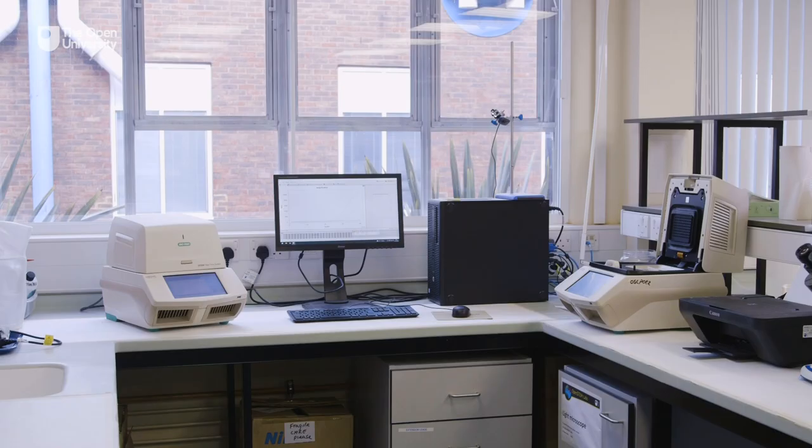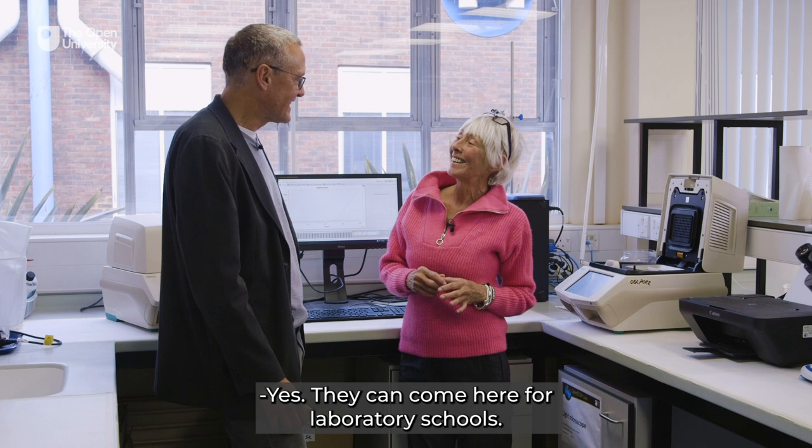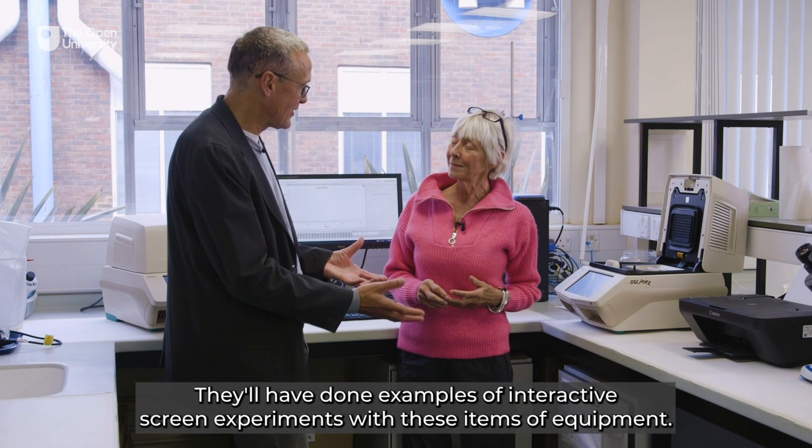Mark, I do love to see bits of kit. So do the students actually get to use these? Yes, they can come here for laboratory schools. They'll have done examples of interactive screen experiments with these items of equipment. They'll come here for three or four days and actually get their hands dirty using the equipment, experiencing the practical aspects of science.